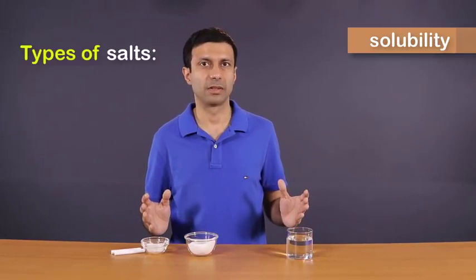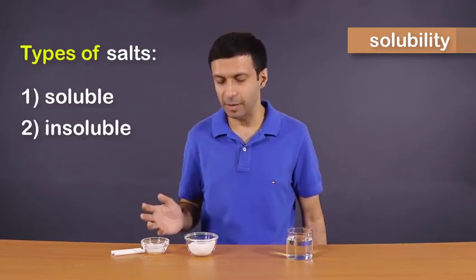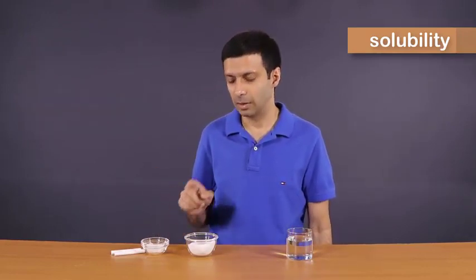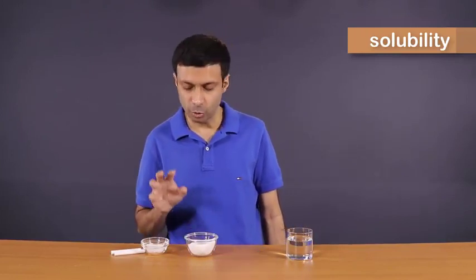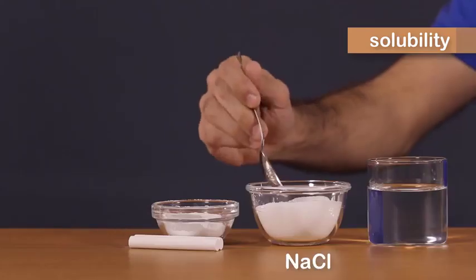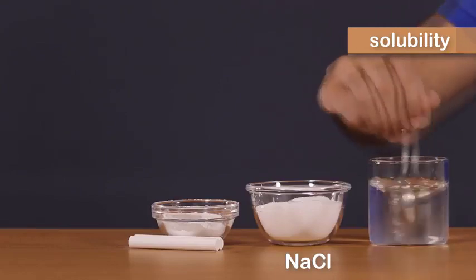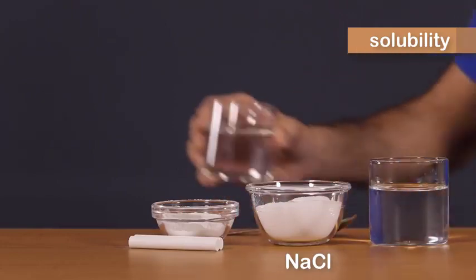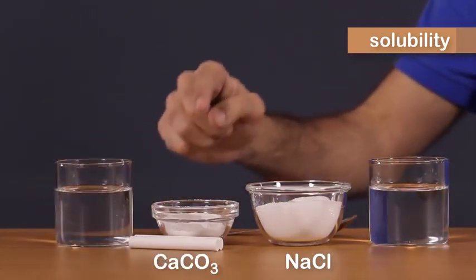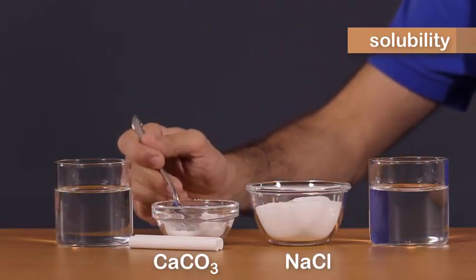Salts are of two types, soluble in water and insoluble in water. Here on this table, I have two salts for you, sodium chloride and some powdered chalk or powdered calcium carbonate. Now let's try to dissolve both of these in water. Let's start by adding sodium chloride in water. Next, let's try the powdered calcium carbonate or the powdered chalk that we have here. So I'm going to add that into the water.